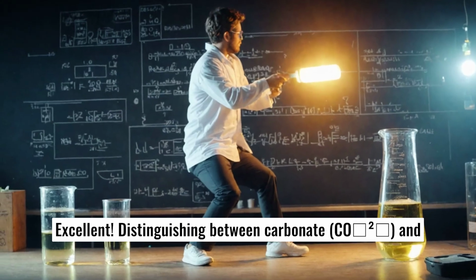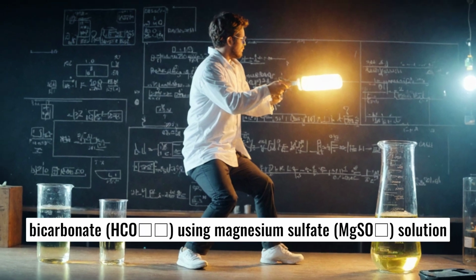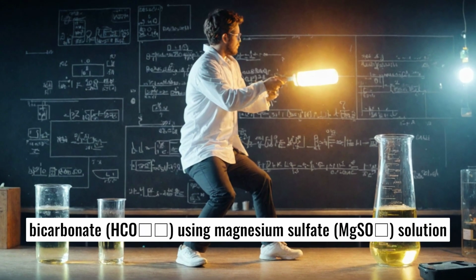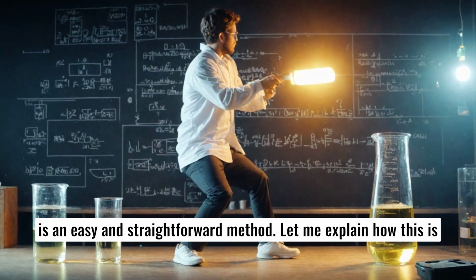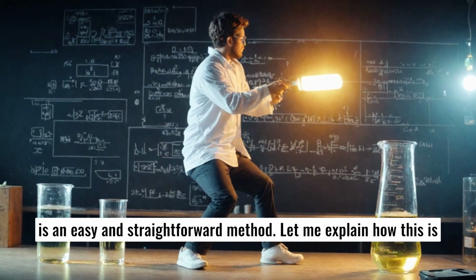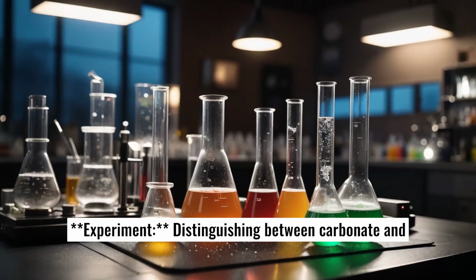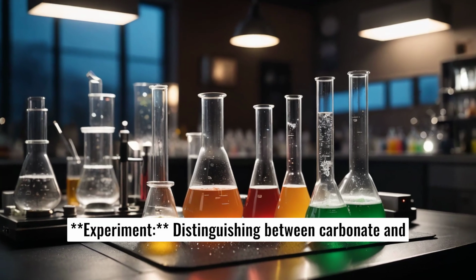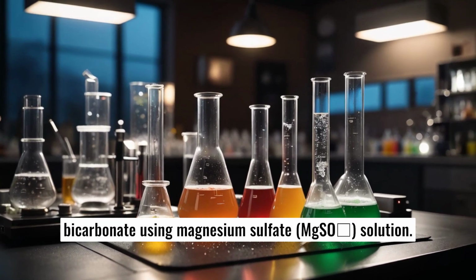Excellent. Distinguishing between carbonate, CO3 2-, and bicarbonate, HCO3-, using magnesium sulfate, MgSO4, solution is an easy and straightforward method. Let me explain how this is done with equations. Experiment: distinguishing between carbonate and bicarbonate using magnesium sulfate, MgSO4, solution.